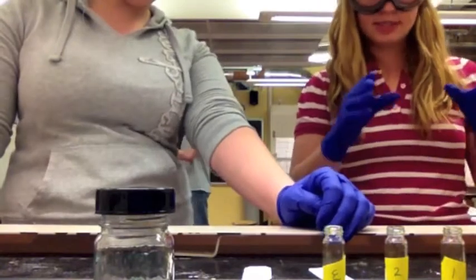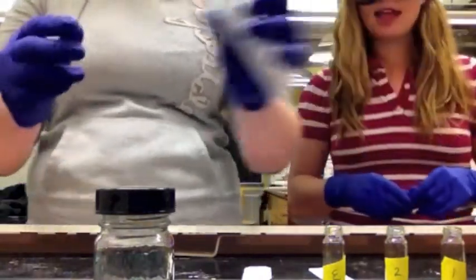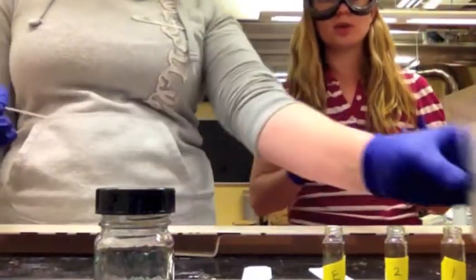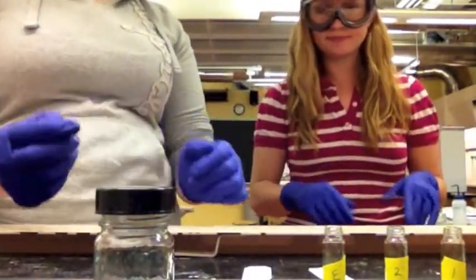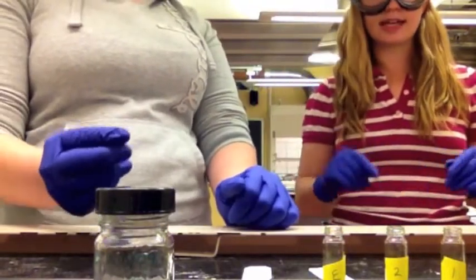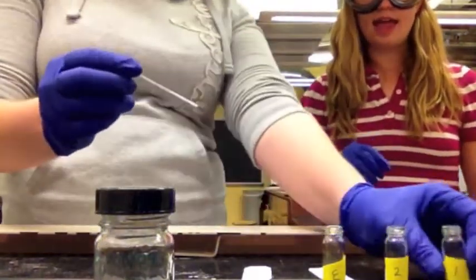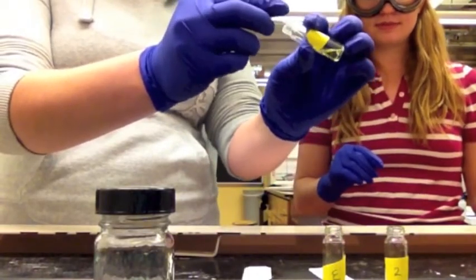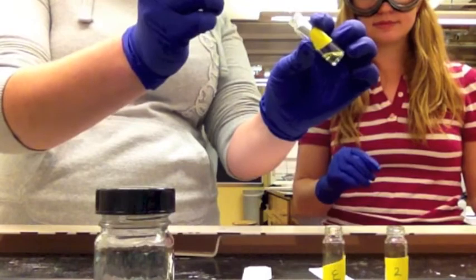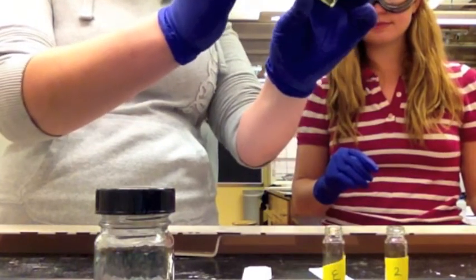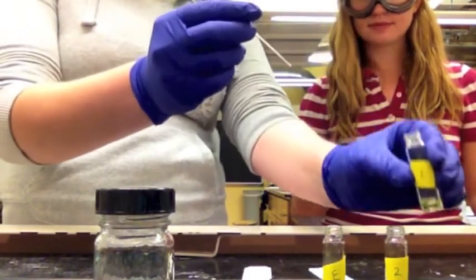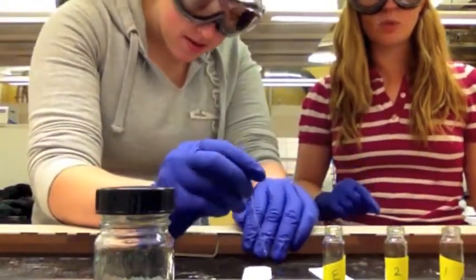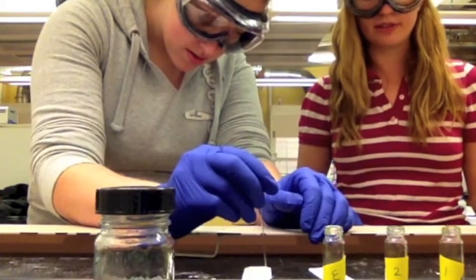Next, you can put the samples on the plate with dye. This has to be done very carefully because using too much will blur and streak the plate. So gently take a capillary tube and get a little bit of sample on the end. Then, place one dot on the starting line tick mark that you drew previously.